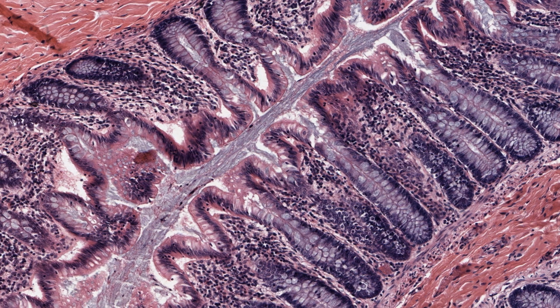These glands of the colon have 2 fundamental functions. First, they're secretory. Their abundant goblet cells produce mucus. You'll have no problem identifying these large, pale cells, and in their cytoplasm is the secretion product, which you may have already noticed has a similar staining to the secretion products in the lumen I pointed out a moment ago.